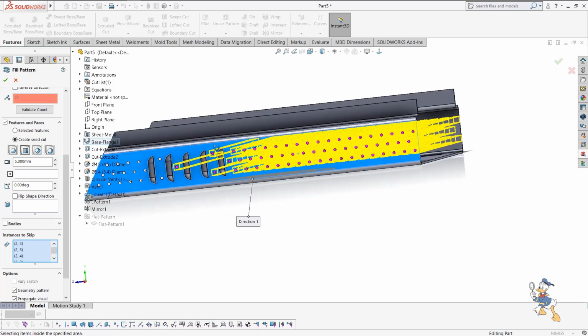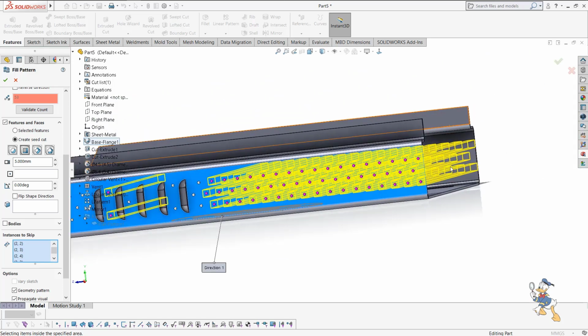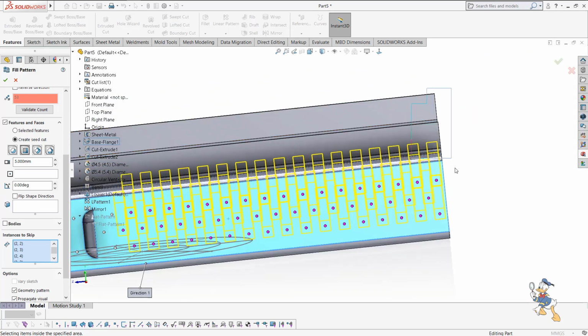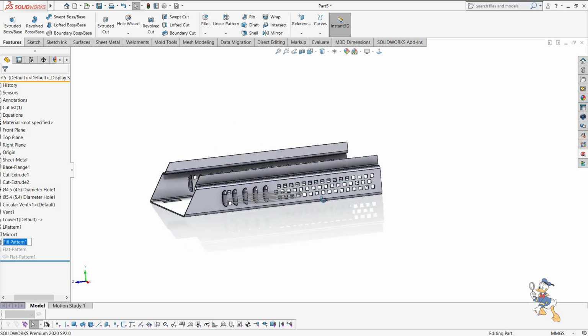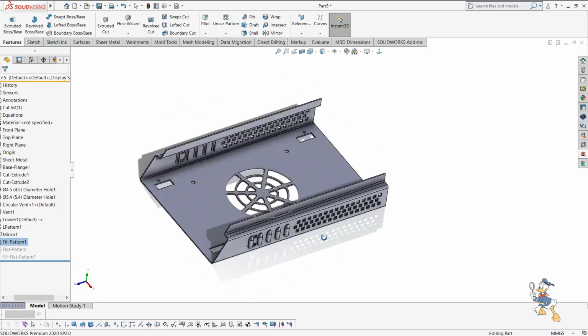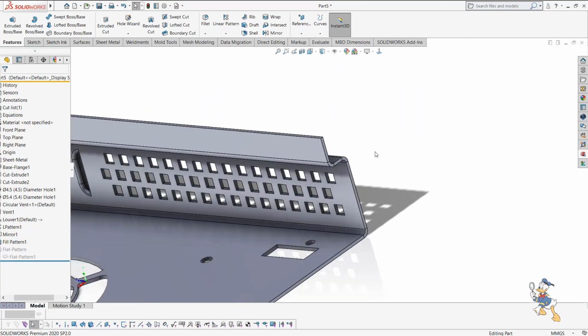We don't need some instance over here. We also don't need some instance over here as well. I don't need this one instance as well. And at the end I also don't need this one, and this one. And after providing the details for the pattern, it generates the pattern on the whole side. So this kind of thing we can design in sheet metal.